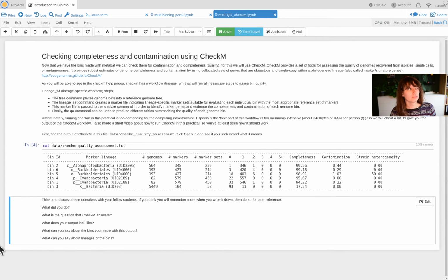And looking at the fact that the whole sampling is sampling microbes that are associated to a certain host organism, perhaps bin 3 is actually leftovers from the host organism, and there's just, by coincidence, some genes in there that are perhaps shared between bacteria and eukaryotes. I don't know what's happening there.